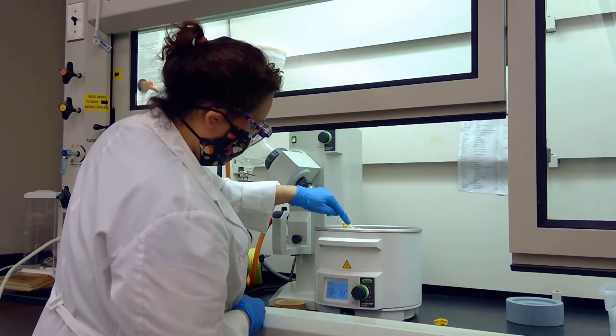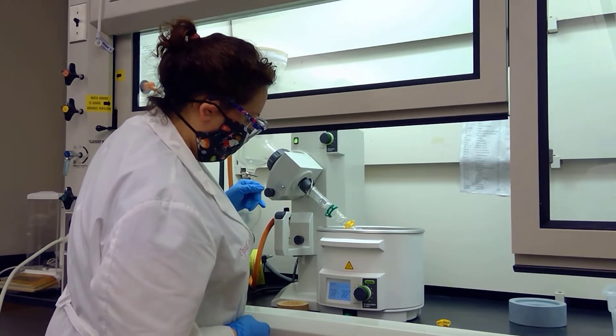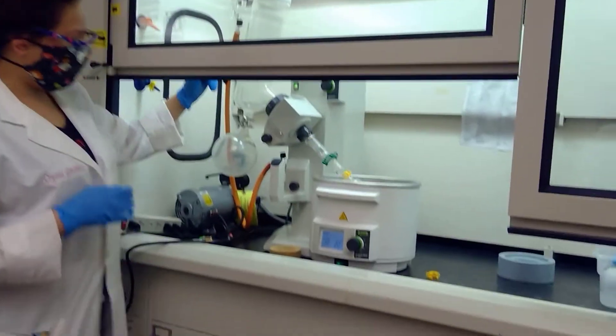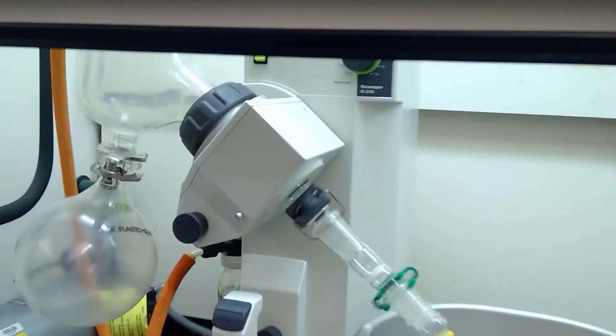Although it's not bubbling, I do see some solid already starting to accumulate on the edges of the glass. We should start to see some liquid recondensing over here on the other side.